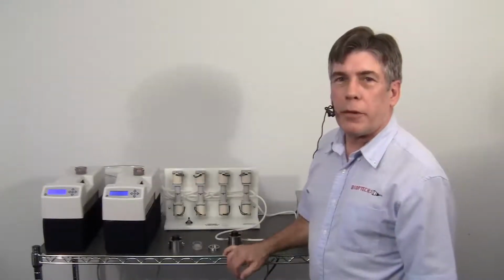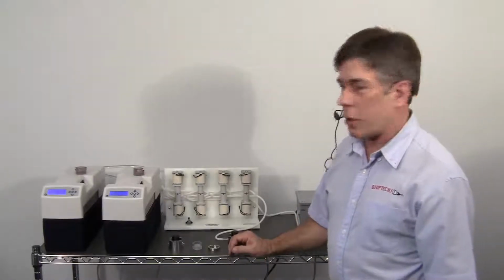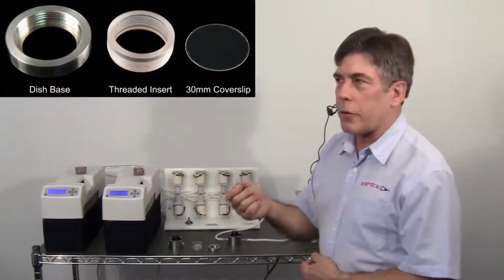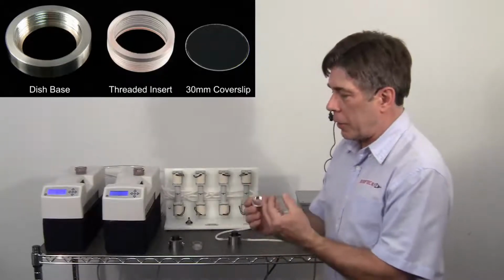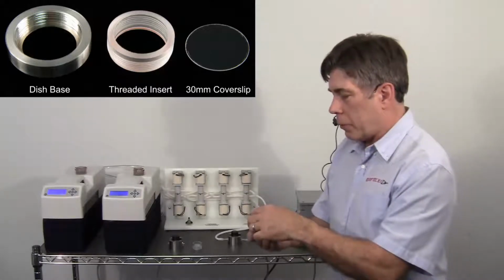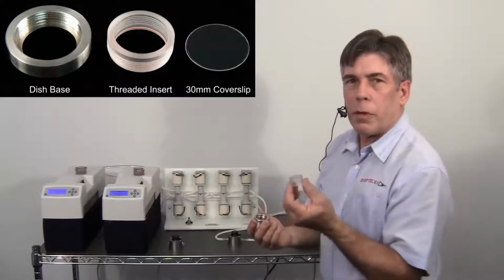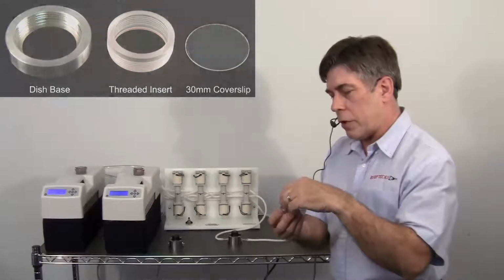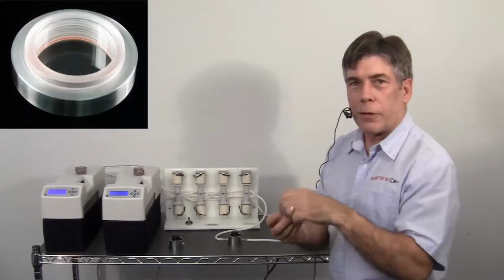In order to accommodate the high numeric aperture objective, the specimen is going to have to be placed onto a cover slip. Now here we have a 30 millimeter number 1.5 D 263 cover slip. This cover slip sits into a Bioptechs ICD, which stands for Interchangeable Cover Slip Dish. The cover slip simply rests in the bottom of the dish, and then an autoclavable polycarbonate O-ring sealed sleeve screws down on top of the cover slip so that you've now made a chamber, basically.